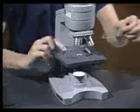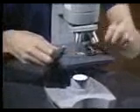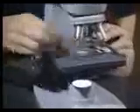Here is a compound microscope with all its important parts labeled. The base supplies support for the microscope. Above the base is the stage. This is where the specimen is placed for viewing. The specimen, which is held on a glass slide, is centered over this round hole in the stage. Stage clips are used to hold the slide in place.